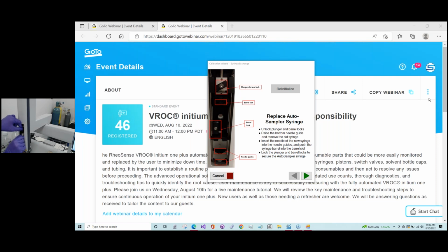Sometimes it goes back, this lever. And you want to be careful to pull the syringe needle straight out. And then since we got it out, we're going to check the piston. For the piston, you want to make sure there's some friction when you move it in and out of the barrel. A good way to practice this is if you have a new barrel and piston, try to feel how that feels first. It should feel very hard to push through. And then you could come back to the one that you're currently using and check to see if it feels kind of the same.